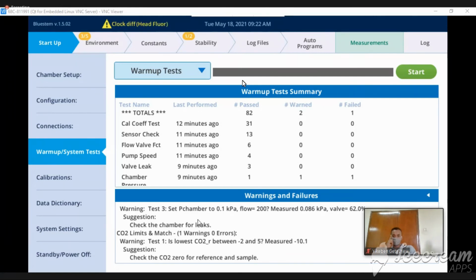So we've got a couple of different failures. We have a warning that P chamber was not quite 0.1, and it was 0.086. That's not really a major problem. I'm not concerned about that. We do see that CO2R is, instead of being between -2 and 5, -10.1 for yours. So that's not between -2 and 5. What we might need to do is go ahead and check your CO2 zero, and we'll talk about how to check and adjust your CO2 zero when we do maintenance calibration, but that might be something we need to look into.